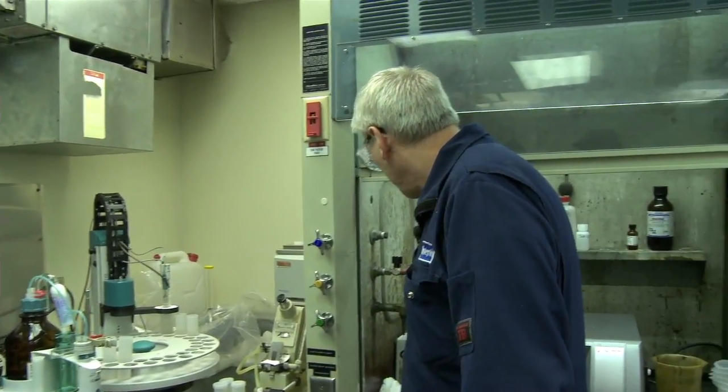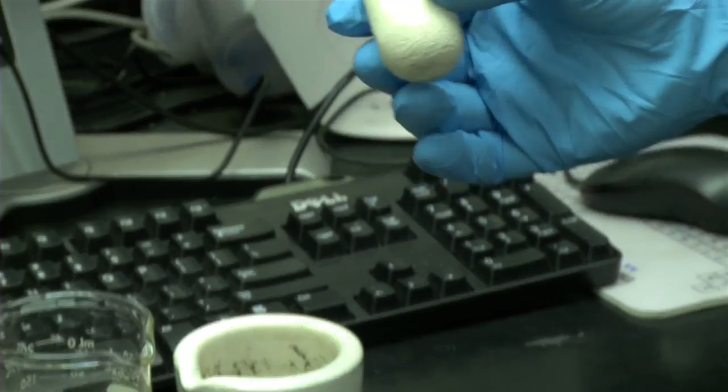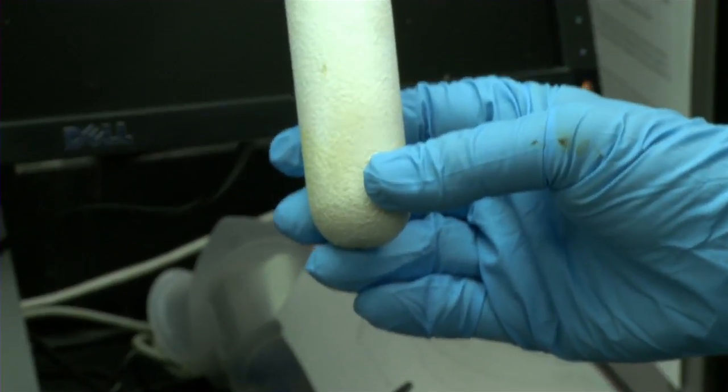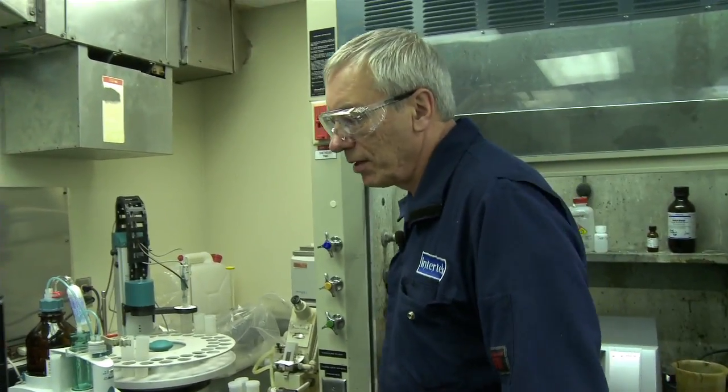Let's see, I'll show you what happens. I have a filter like this, so I'll put that material in there, and I just poured that out into there. Then I will run an X-ray pellet on it, and I'll also run some other tests, which give the loss on ignition, the acid insolubles and acid solubles on this solid material. So it's very helpful to those people that are interested in finding out the nature of an unknown solids material.